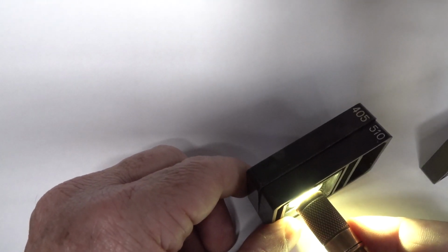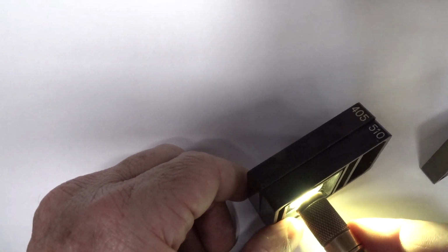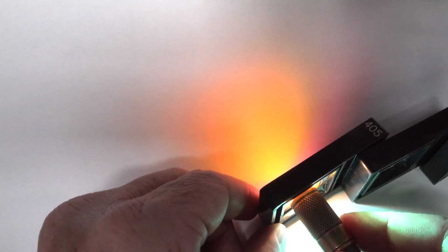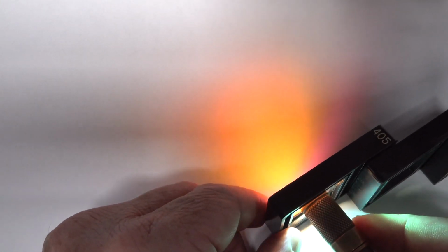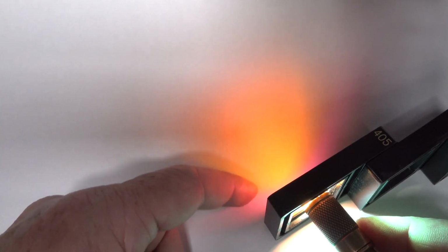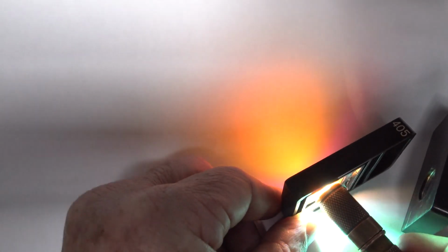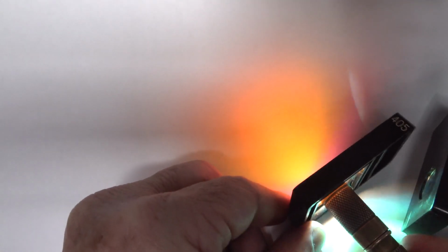Oh, no. Hang on. That doesn't get through. 405 and 510, and it doesn't get through? Okay, these definitely have different bandwidths, no doubt about it. Whoa, isn't that lovely? It's a lovely orangey. It's pinkish around here, but orangey over there. Oh, there's the pink. It's the pink reflecting somewhere else, but it can't go under. It's reflecting off the black or something.